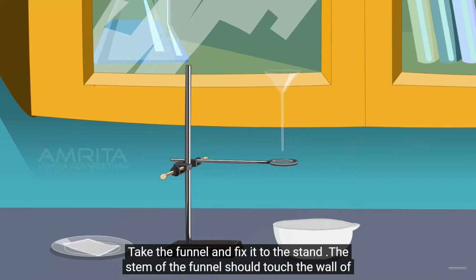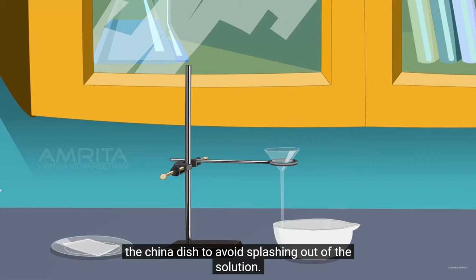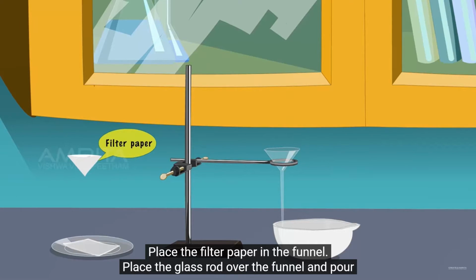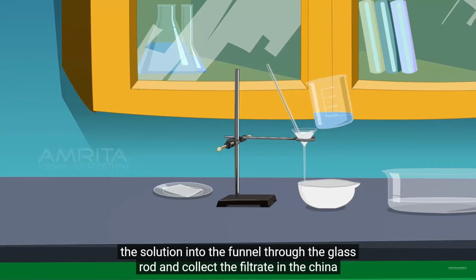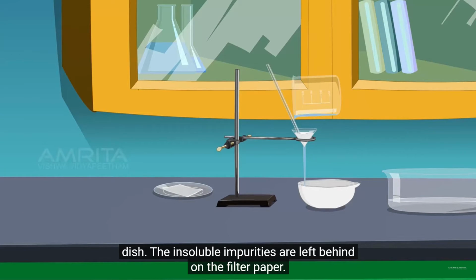Take the china dish and place it below the stand. Take a funnel and fix it onto the stand. The stem of the funnel should touch the china dish to avoid splashing out of the solution. Place the filter paper in the funnel. Place the glass rod over the funnel and pour the solution into the funnel through the glass rod and collect the filtrate in the china dish. The insoluble impurities are left behind on the filter paper.